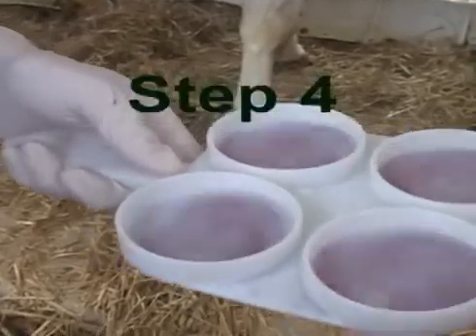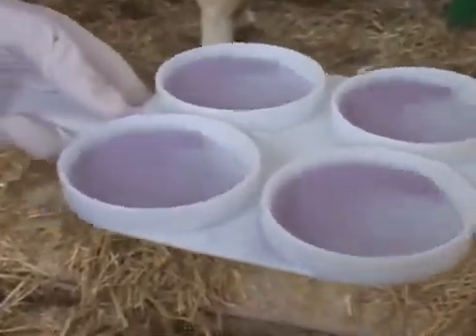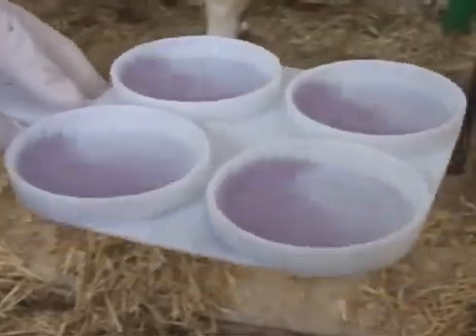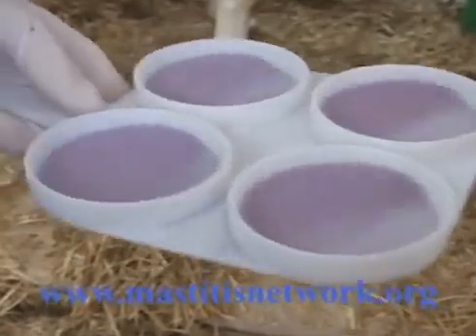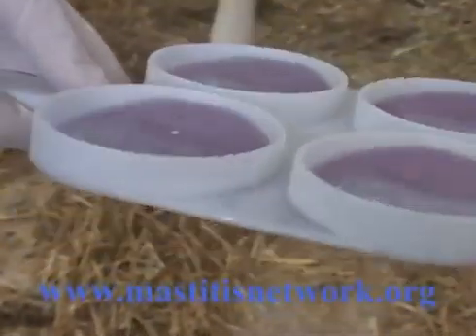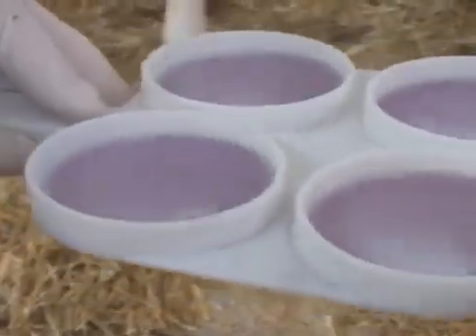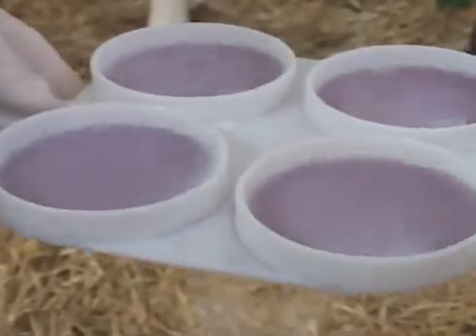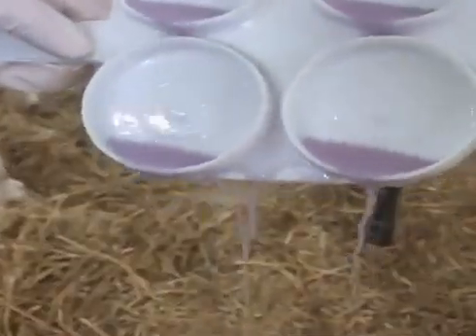For the fourth and last step, mix the reagent with the milk by swirling the paddle for 10 to 30 seconds. You must interpret the results for all 4 quarters immediately. Maintain the swirling action and tilt the paddle from side to side and watch for any gelling of the mixture. Then, pour out the content of the paddle and watch closely to see how the mixture pours out.